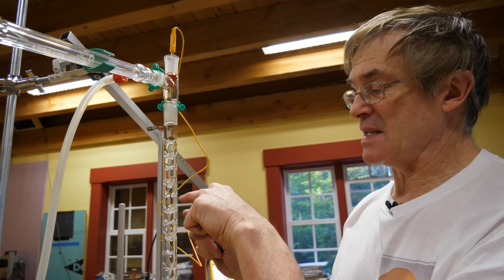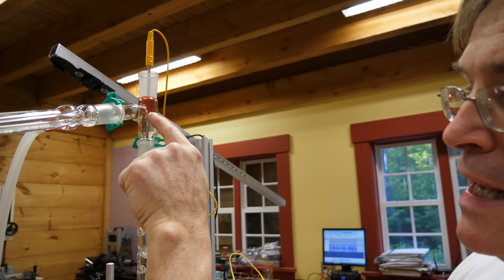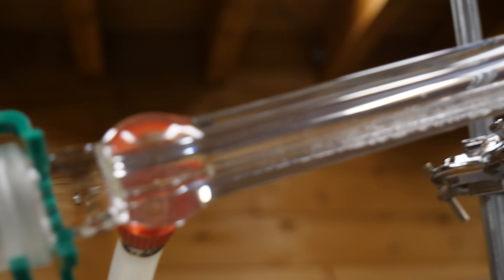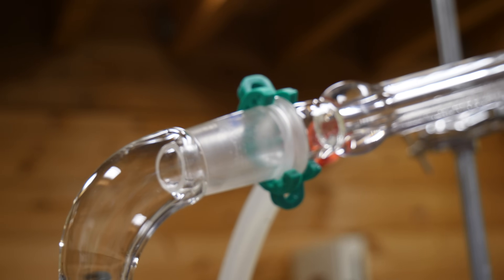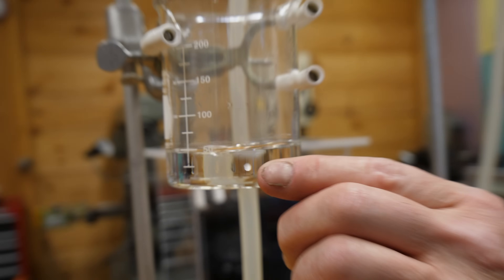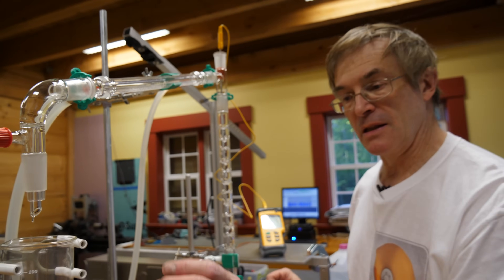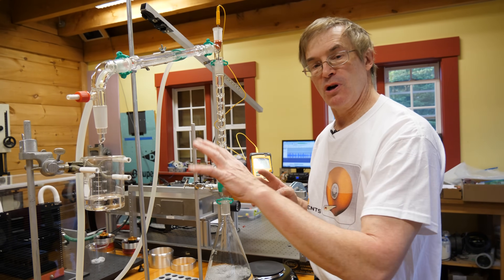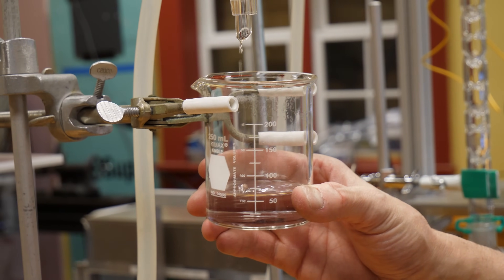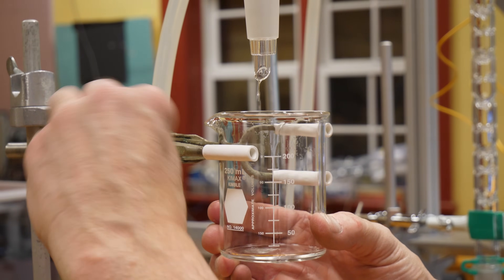As the cycle continues heating the glass progressively higher, eventually some vapors reach the top and move down the side arm. At that point, rather than dripping back into the container, they drip through the condenser — which has a central column carrying vapor surrounded by cold water on the outside — causing condensation and collection in the container below. The material collected is primarily alcohol but contains a little water. If we continued until all liquid was gone, we'd end up with exactly what we started with.